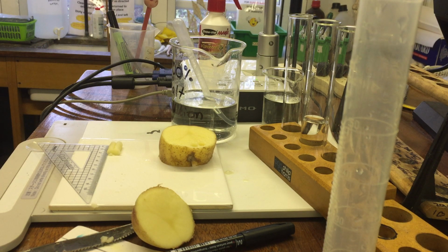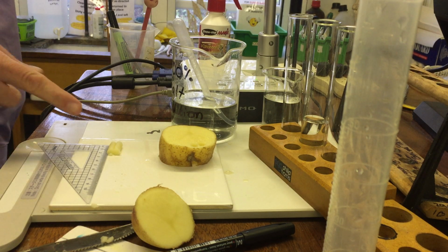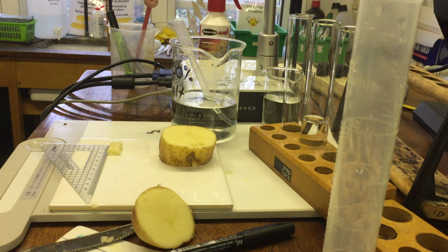Make sure you've written down the starting masses in the table. Okay, and then, it doesn't have to be simultaneous, really, it's not that precise, but place all of the potato chips into the solutions. Okay, remember, this is a common mistake, do not place the potato chips into the solutions before you've measured their initial mass. A lot of people get carried away and start putting the potato chips in there and realise they haven't measured the mass and have to take them out again.